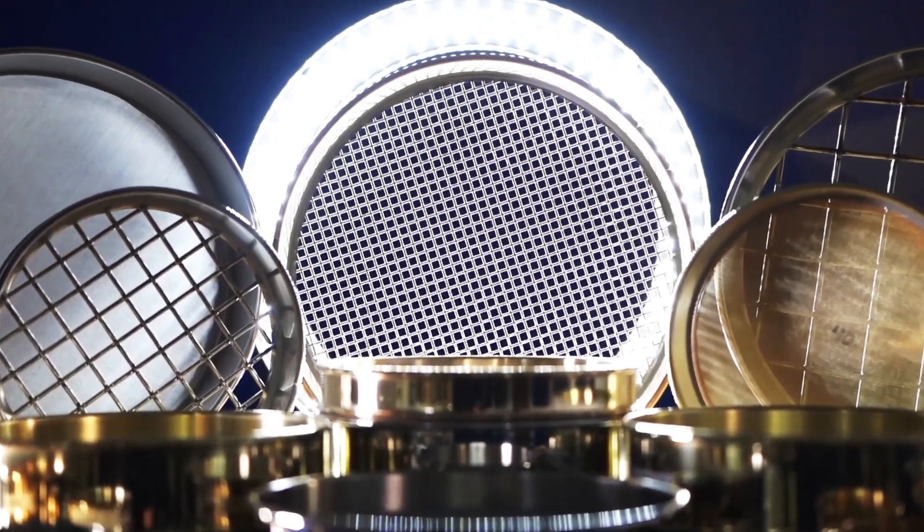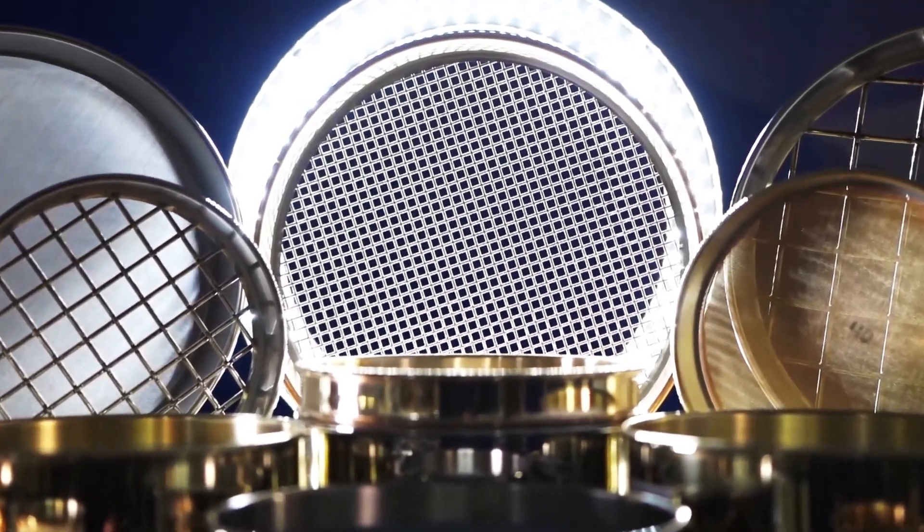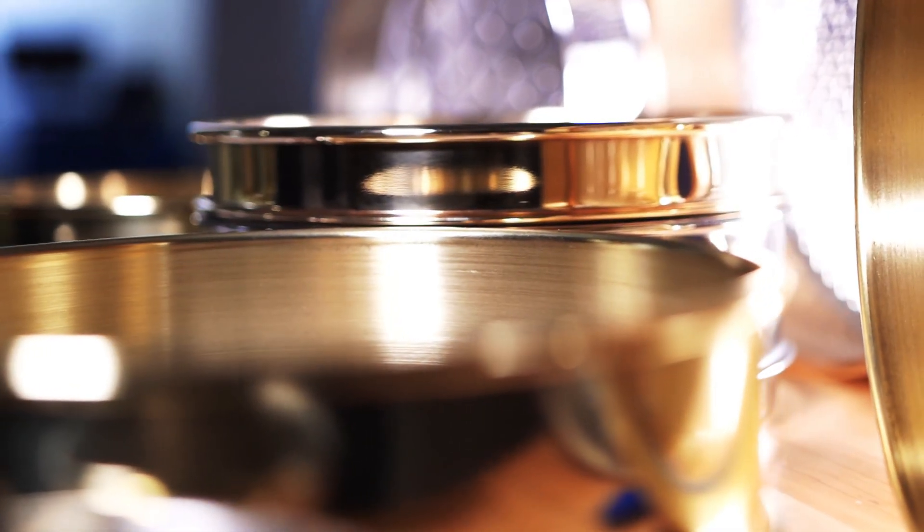Test sieve standards relate to the construction of the sieve itself as well as the performance of the test sieve. Every industry is different, which means that there are many different sieve standards out there. Your industry standards will tell you the required mesh size, how many test sieves you need, how much of a sample to use, if a sieve shaker is needed, how long you need to run your sample for, and whether or not you need your sieve certified or calibrated. There are two types of standards that are most commonly used in the world: ISO 3310-1 and ASTM E11. Typically ISO standards are international standards and ASTM are the North American equivalents.